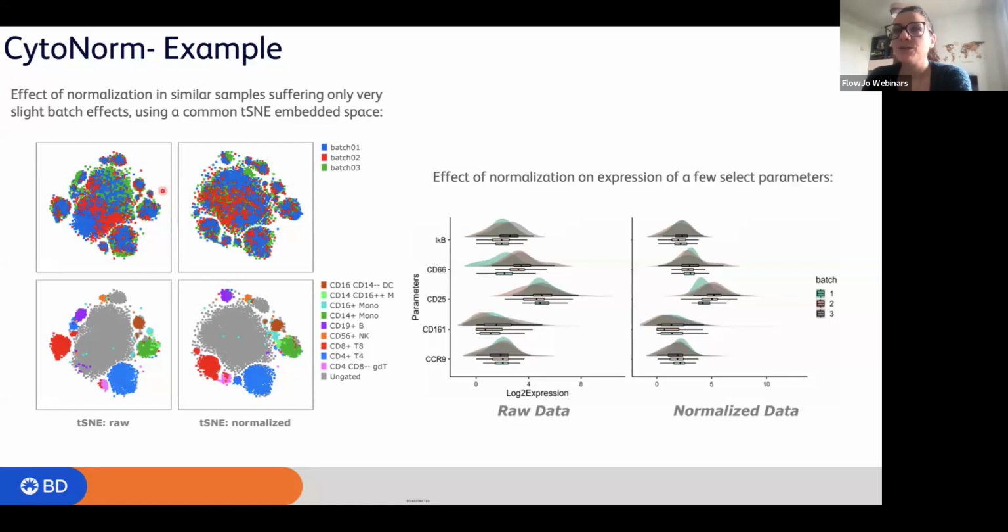One more thing could be, I don't know, maybe your antibody has been outside of the fridge, or your sample came over the weekend and you didn't have time to process the sample on Friday night, and then you just left the sample in the fridge for like 2 extra days, and then you came Monday morning and you pulled everything together, and then you see this kind of output right here. And this is for sure a batch effect.